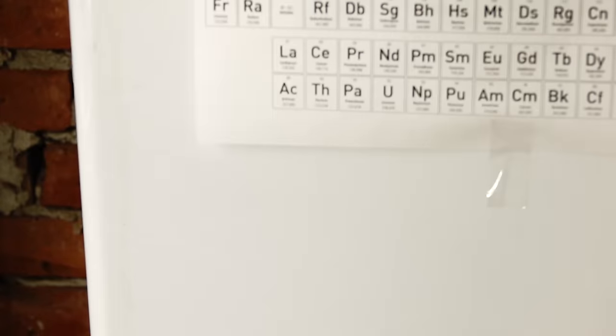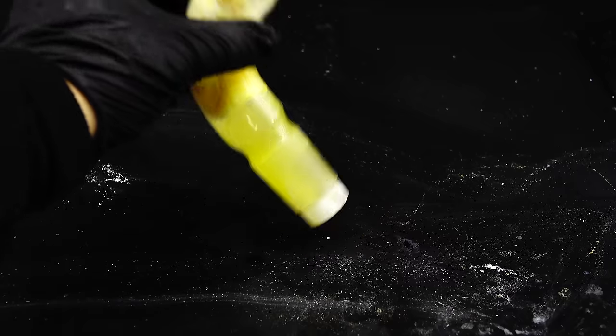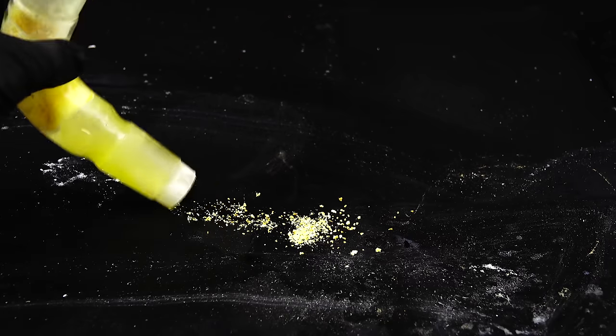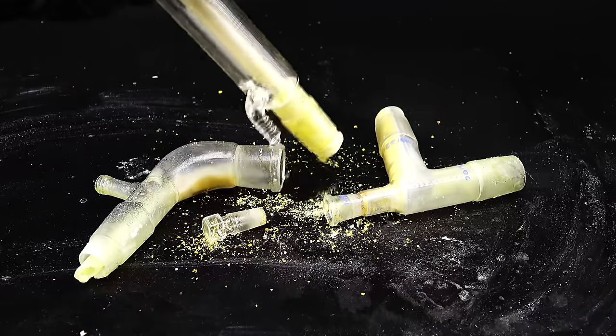It looked well dead with dirty glassware laying all over my fume hood and paired with this weird smoking condenser this whole setting looked just like a typical chemistry moment.